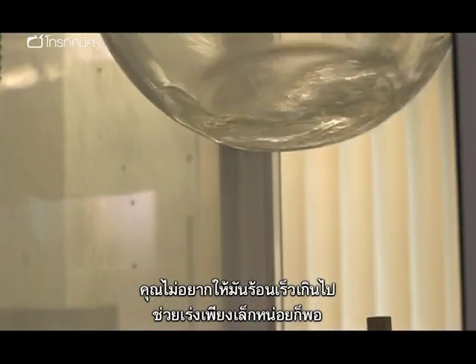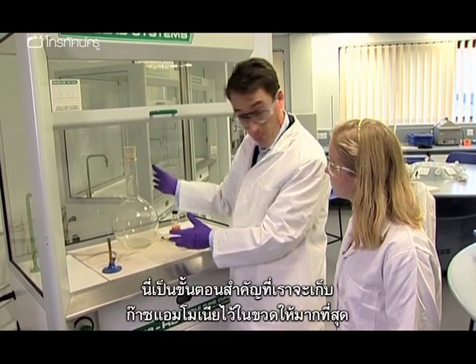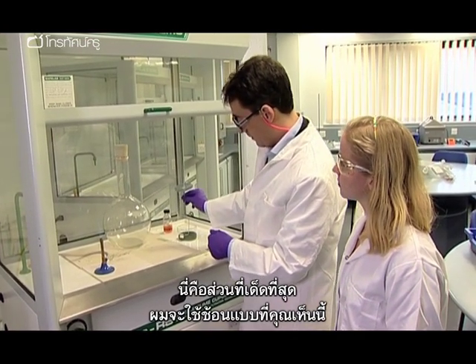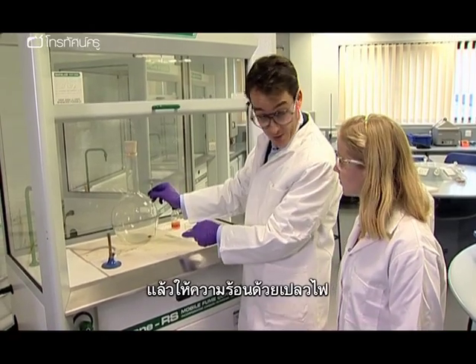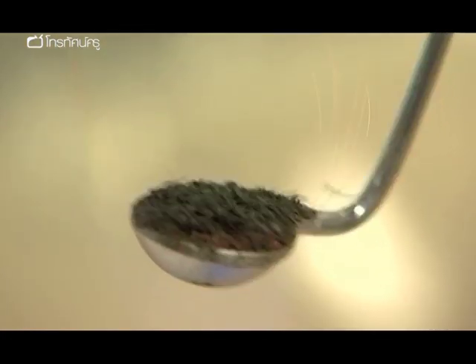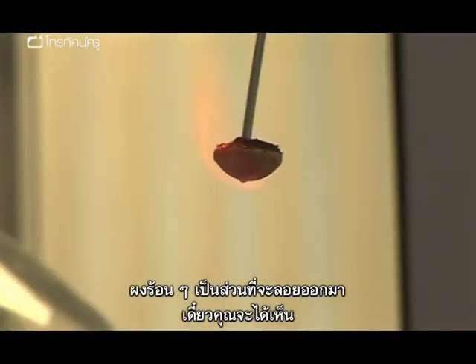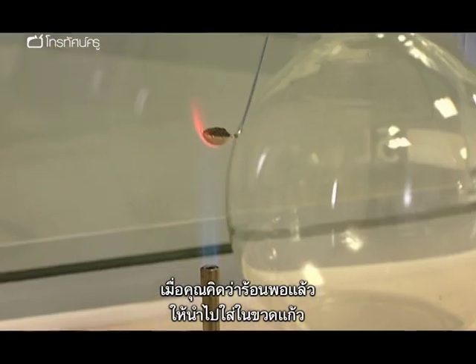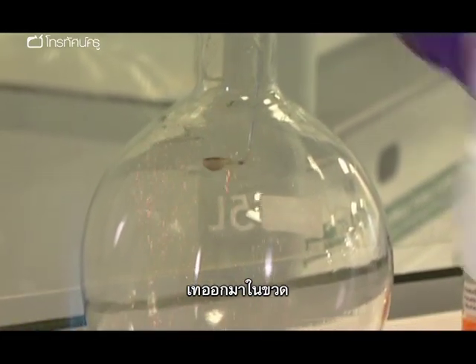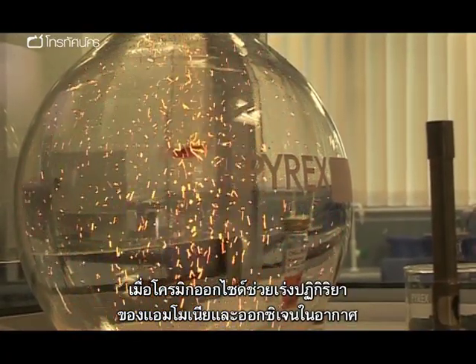You don't want to heat it up too much, just warm it ever so gently. Then I put the bung back on — that's quite important, because then I trap as much ammonia in there as I possibly can. Now here's the best bit. I take the deflagrating spoon with the chromic oxide flakes on the end, and heat them up in the flame. You can see some of the flakes just popping off the spoon. These hot flakes, because they're so light, float around. When you think you've got it nice and hot enough, it's into the flask — and you need to move quite quickly. The flakes glow as chromic oxide catalyzes the reaction of ammonia and oxygen from the air.